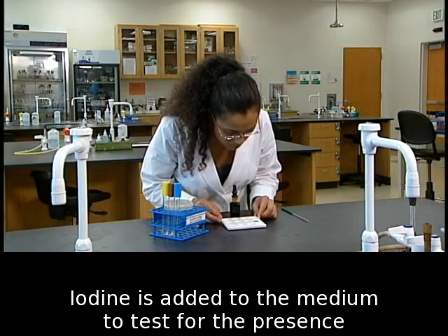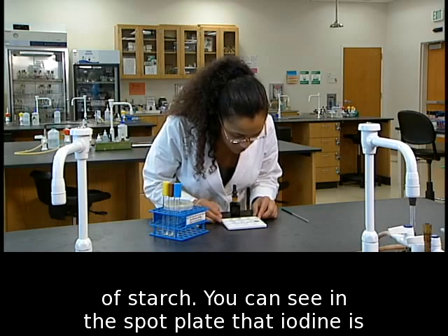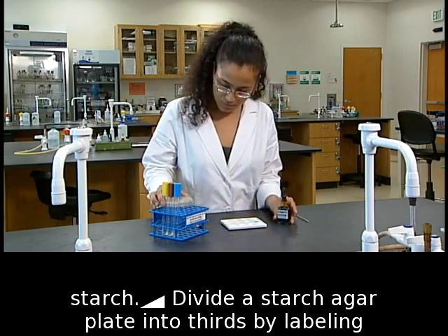Iodine is added to the medium to test for the presence of starch. You can see in the spot plate that iodine is brownish. The iodine turns blue when mixed with starch.